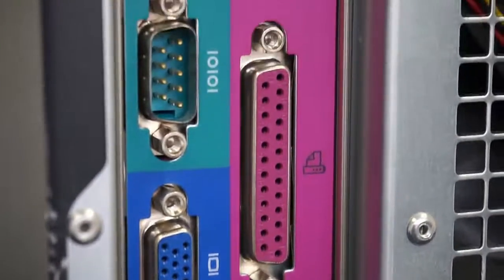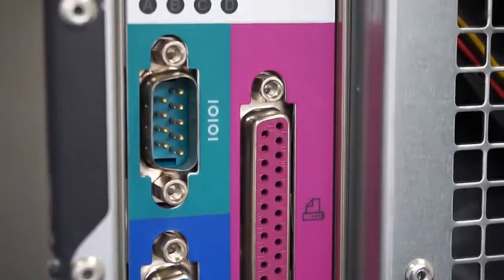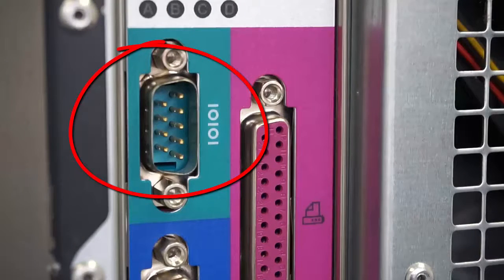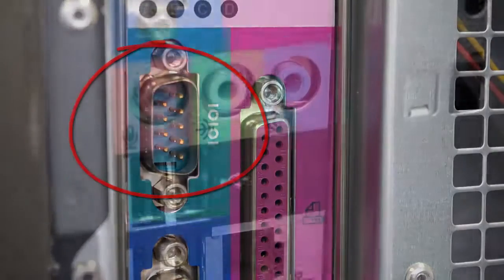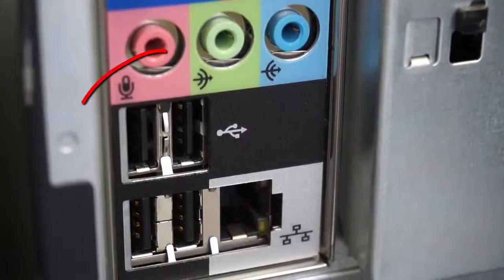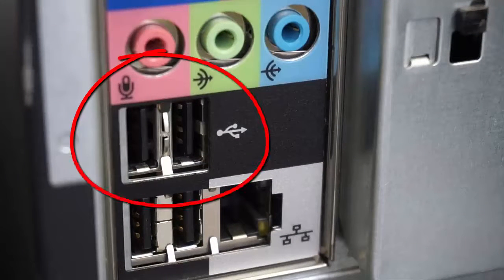Next, let's check out the available connectors on your PC. The RS-232 ports on most PCs are 9-pin male connectors, and the USB ports on a PC are typically Type A connectors.